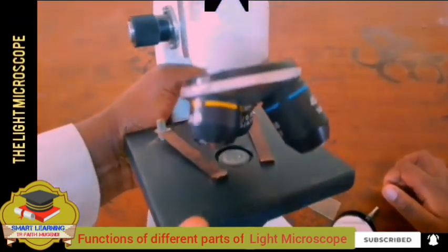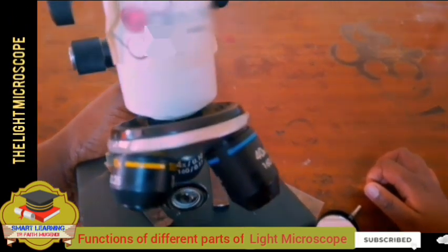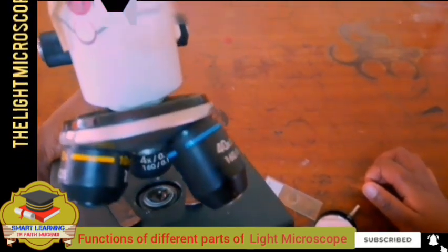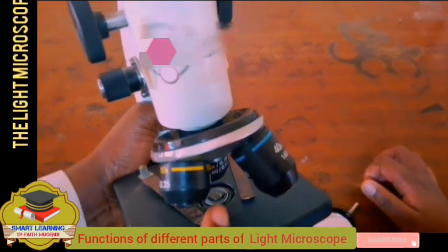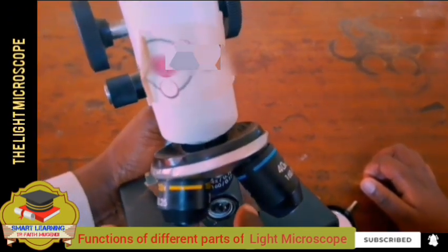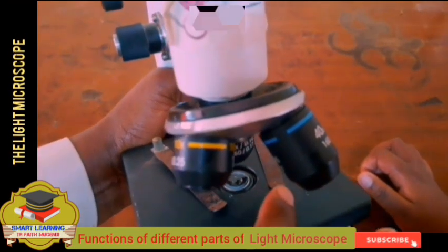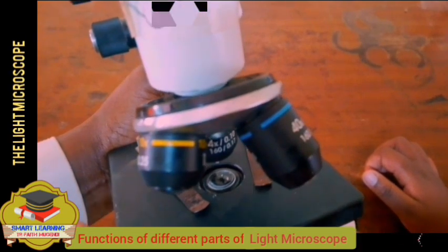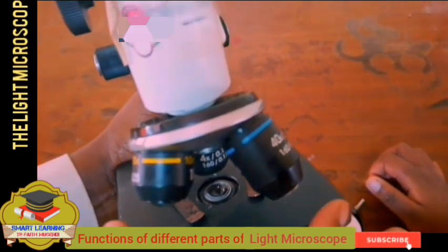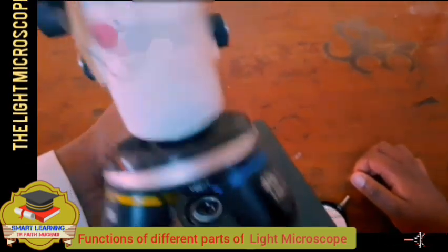Now we look at the stage. We normally say that the stage is a platform where a slide that contains the specimen that we are going to magnify is placed, and we also have some clips. Clips, just like we normally have hair clips, are used to hold the hair so that in case of wind it is not blown away.